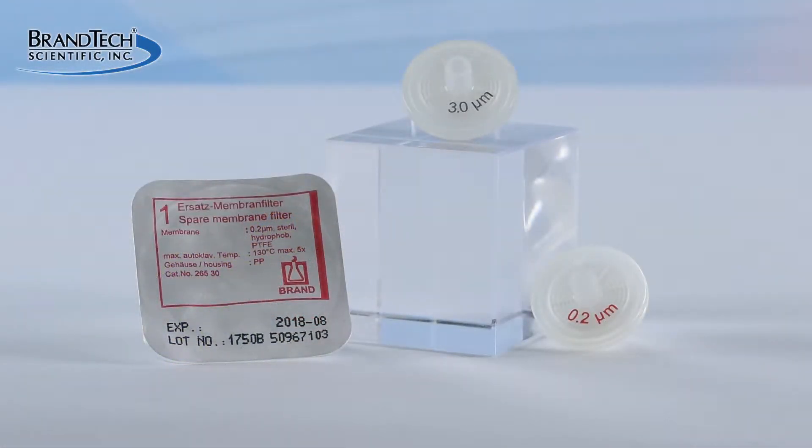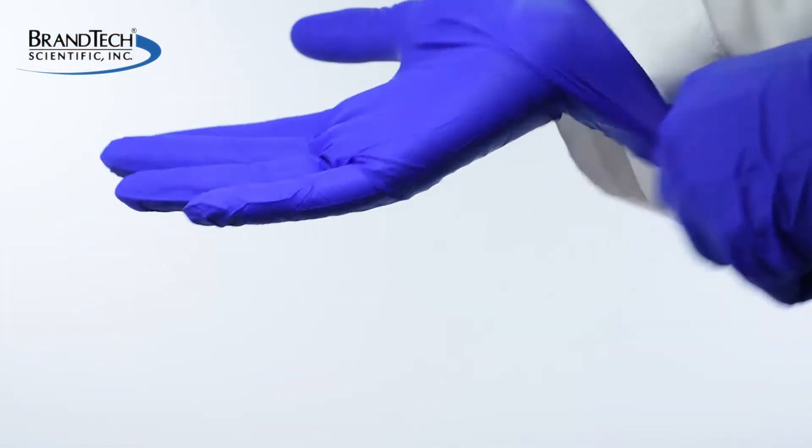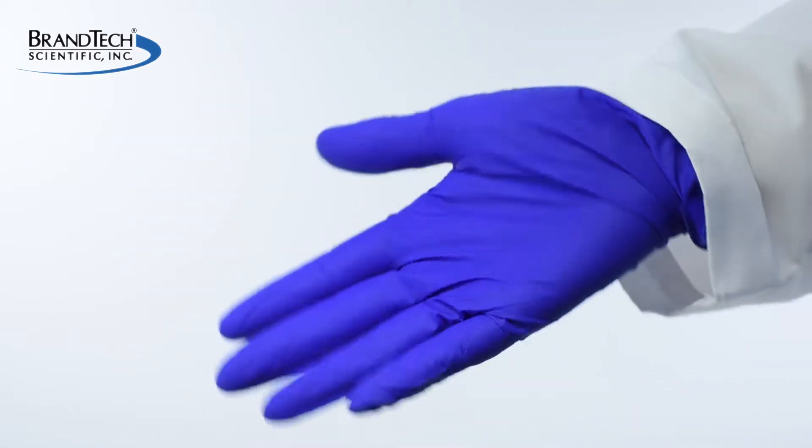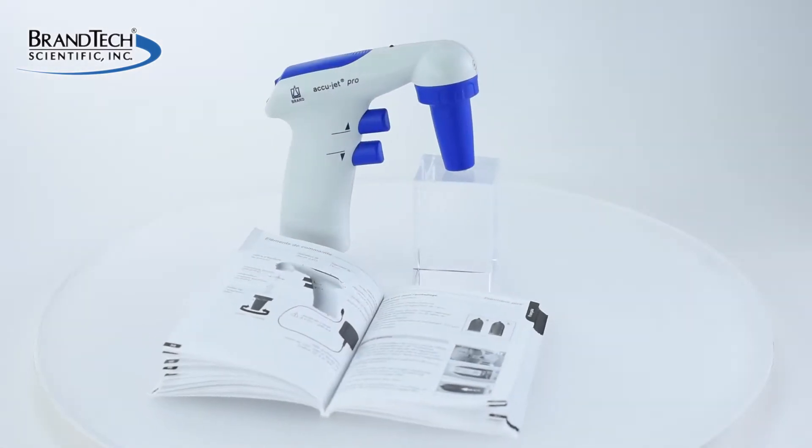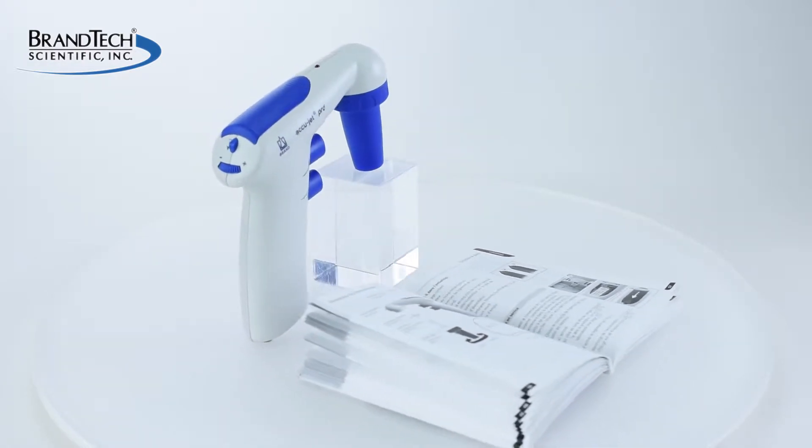This video will demonstrate how to change the protective filter for your AccuJet Pro or AccuJet pipette controller. Before working with the AccuJet, wear all the appropriate personal protective equipment and observe all safety precautions. Always refer to your operating manual for specific instructions for maintaining your particular AccuJet model.